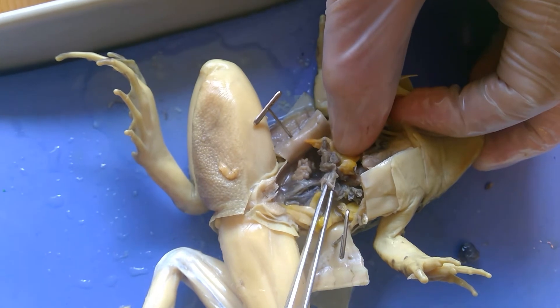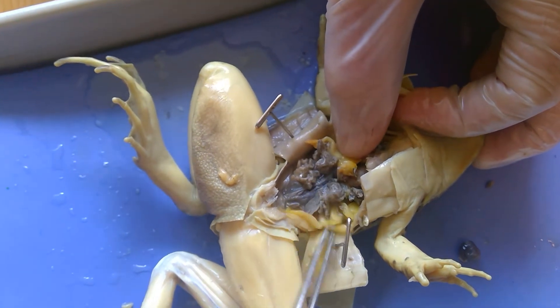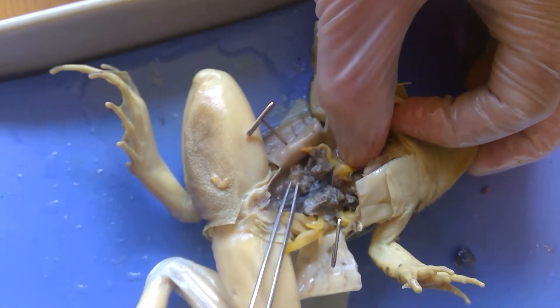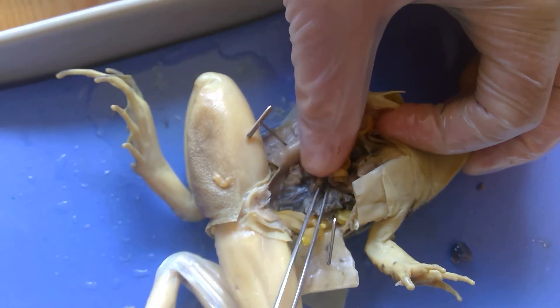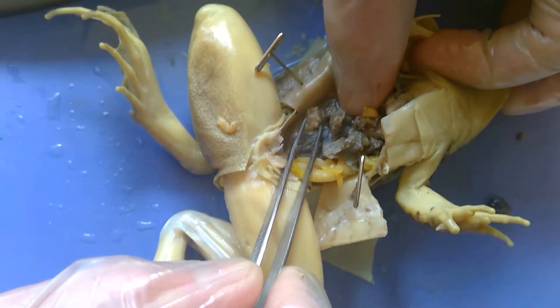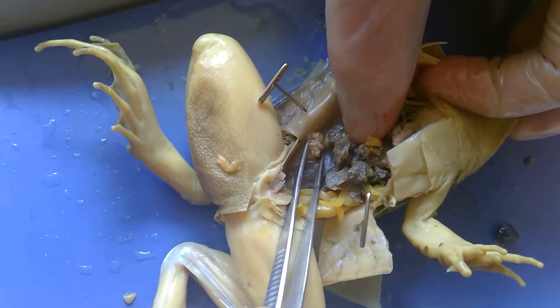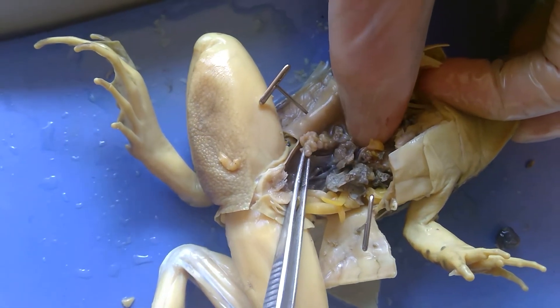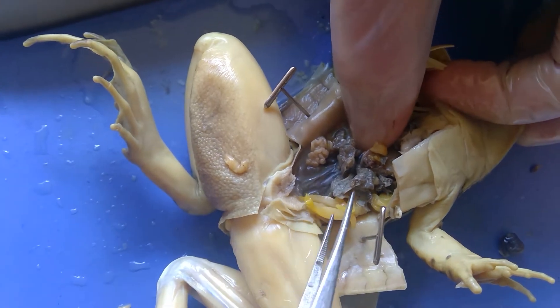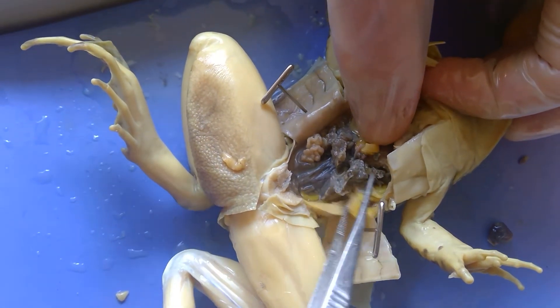This frog is going to lay hundreds of eggs at a time, so it has an ovary here and another ovary on the other side. Then it has the equivalent of your fallopian tubes — also called the oviduct. It's not going to have a vagina or a uterus, because a uterus is where a baby would grow.